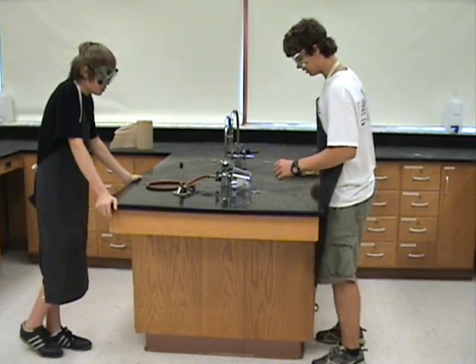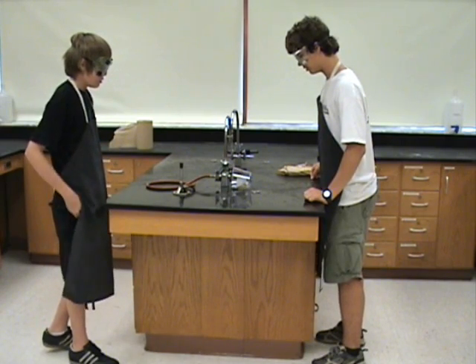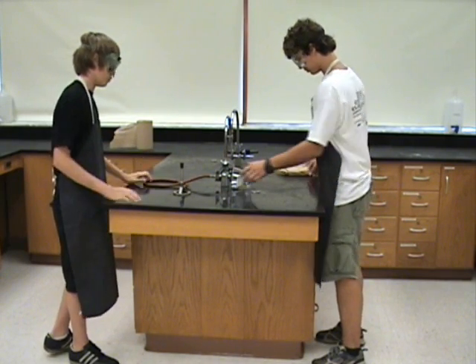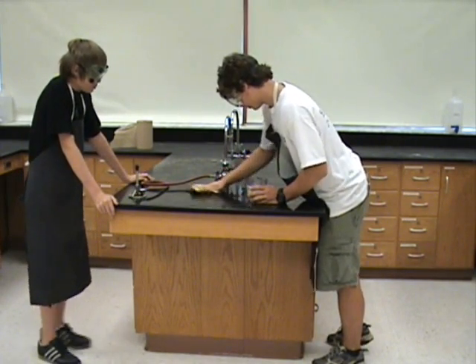Observe the correct procedure, which ensures safety. Look, dude, I just spilled this highly flammable liquid onto the table. You should clean that up before I light my burner. Clean up any chemical spills immediately.